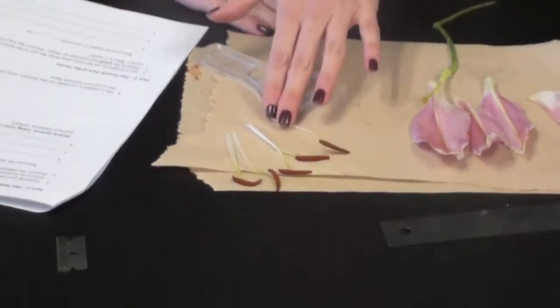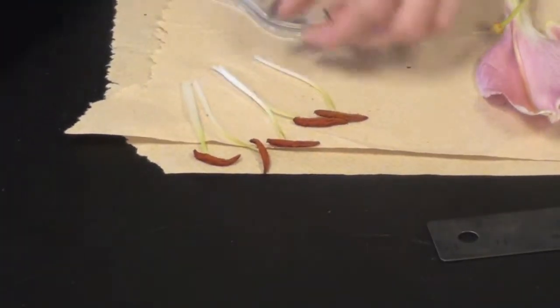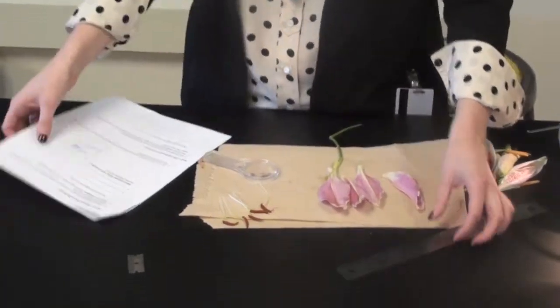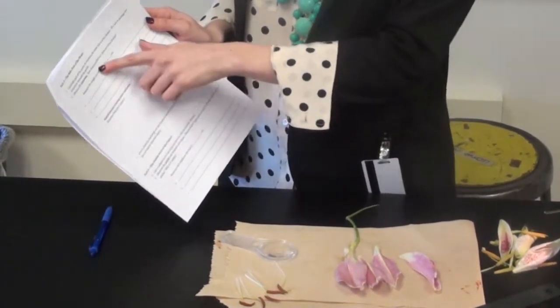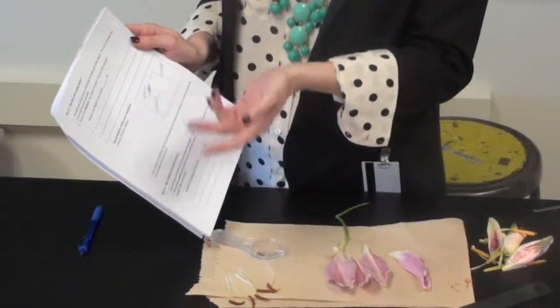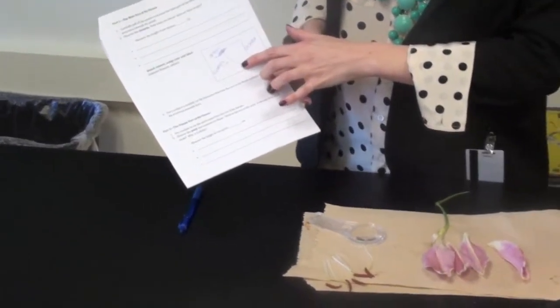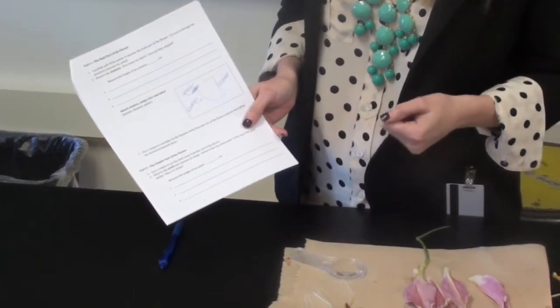So I took all of the stamens off of the flower, and once again you are going to take the stamen and you're going to measure it. You only have to measure one of them, write it on the line, and then make different observations. So think about how many are there and how are they shaped, what are they used for. And then in the box you're going to draw a picture of what you saw using color, and then make sure you label the stamen, the anther, and the filament, all three parts.